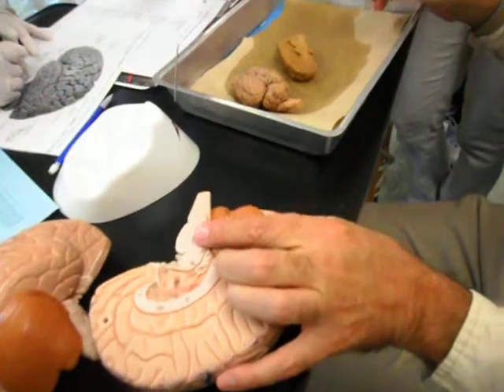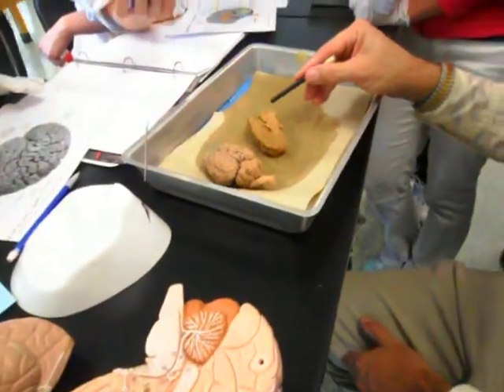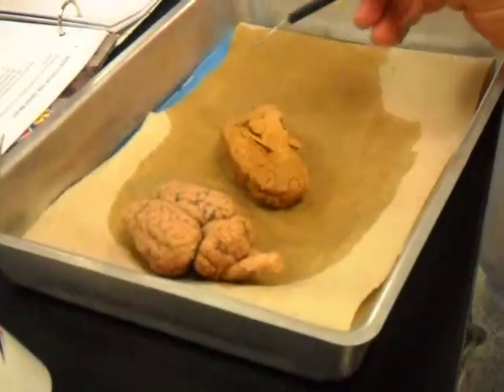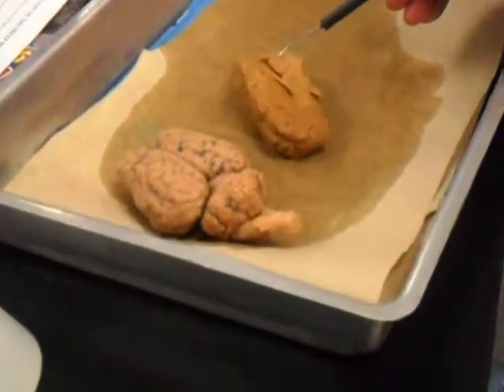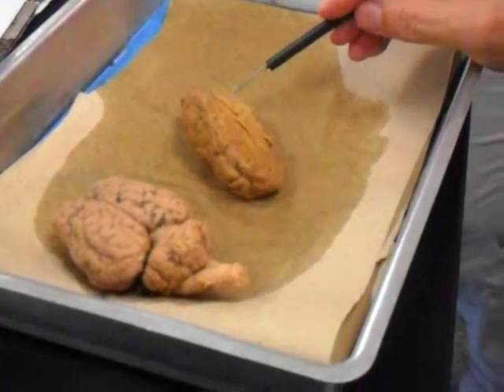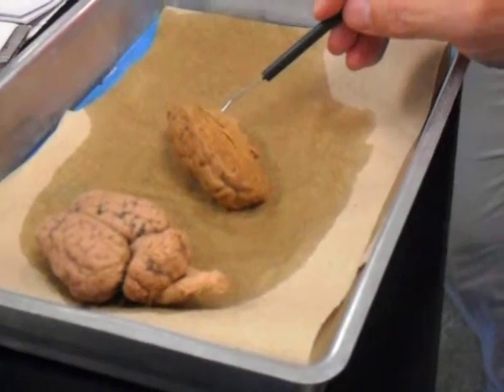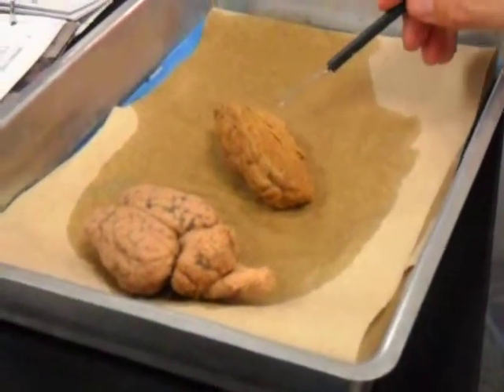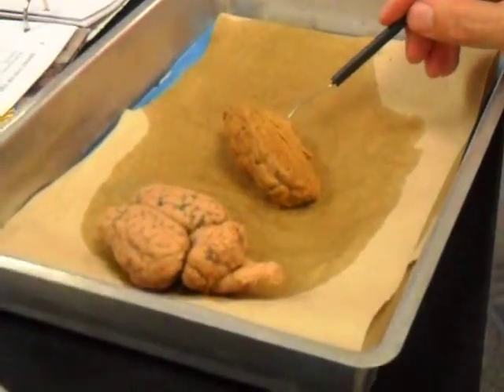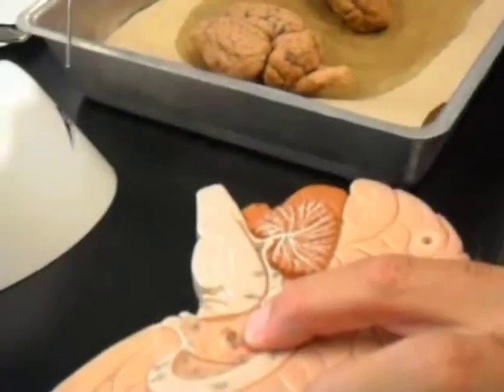Pons. That's the pons. Okay, who's this guy in the back over here? Cerebellum. Transverse fissure. There's a hole right there, which is the same as that hole right there. Fourth ventricle. What's this tube going up top? Cerebral aqueduct. The brown dot right here on the brain. Intermediate mass of the thalamus.